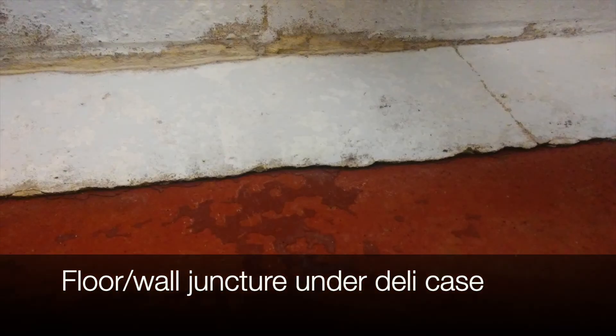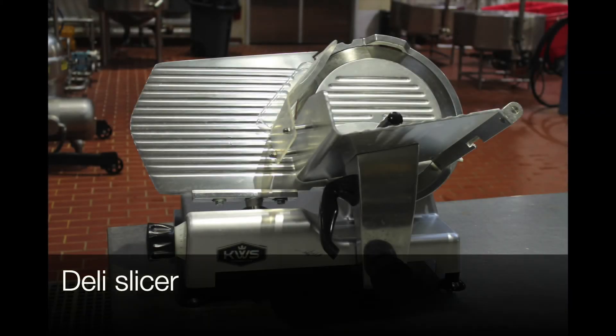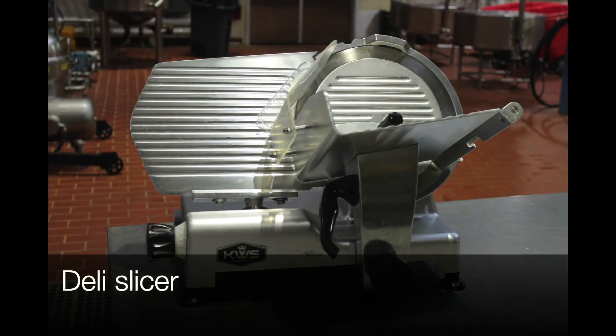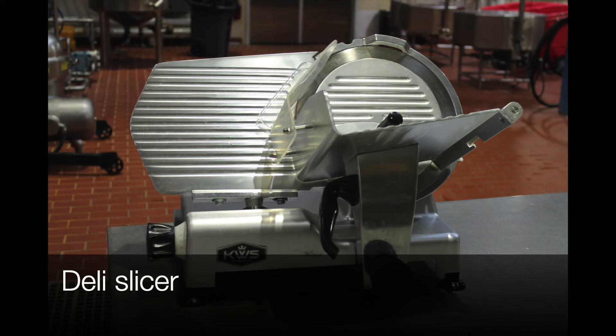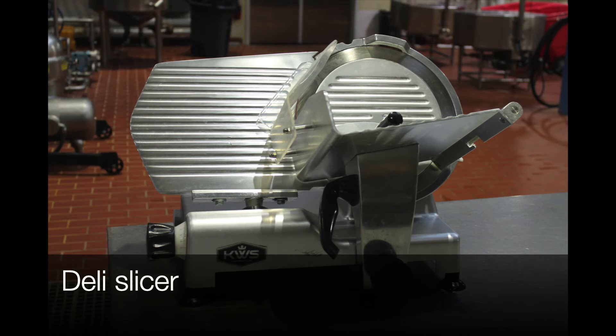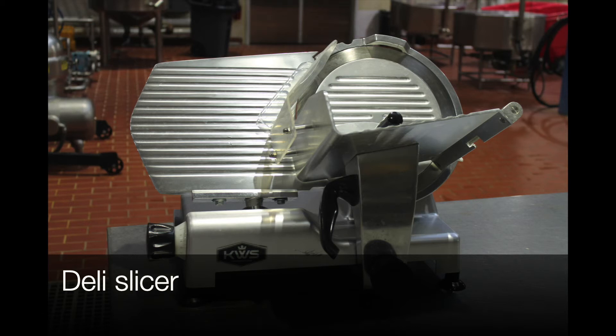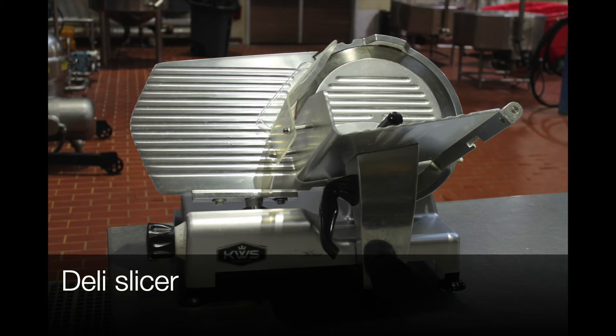Floor-wall juncture under the deli case. Deli slicer: During cleaning and sanitation procedures, this piece of equipment might be partially disassembled at best, leaving room for residue to accumulate in deeper parts of the equipment that are never reached by cleaners or sanitizers if not taken apart properly.